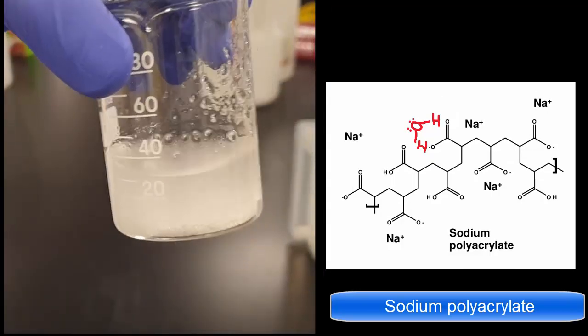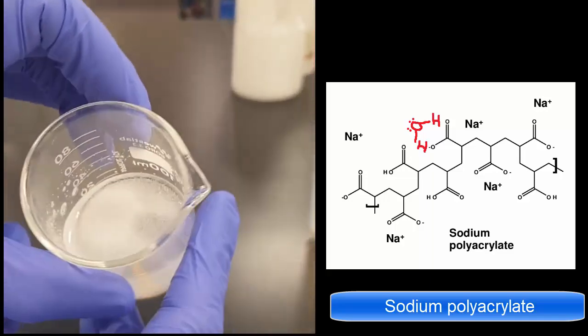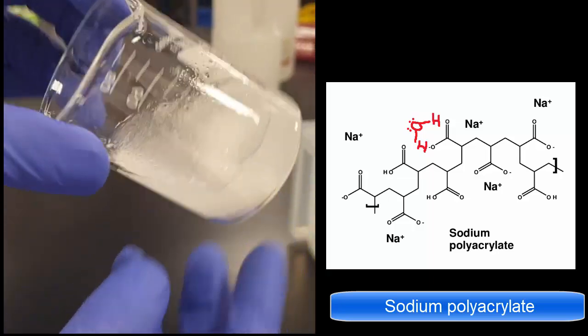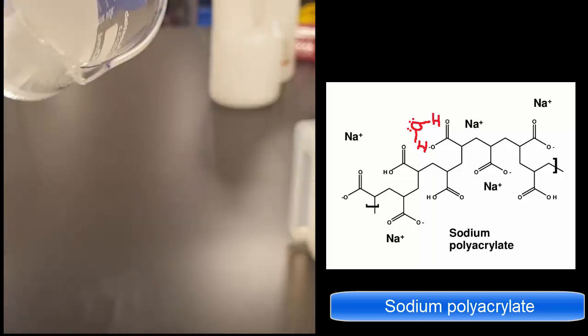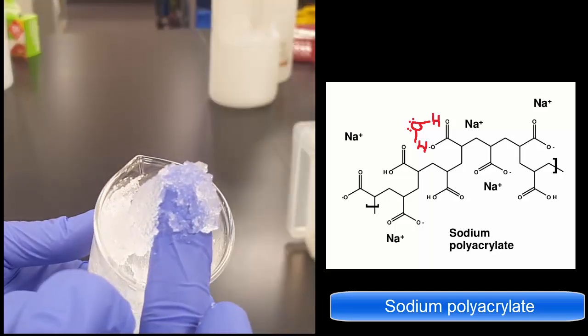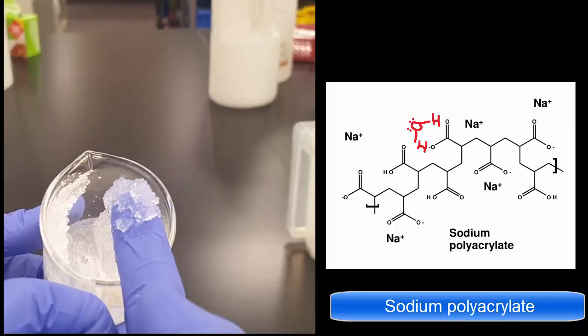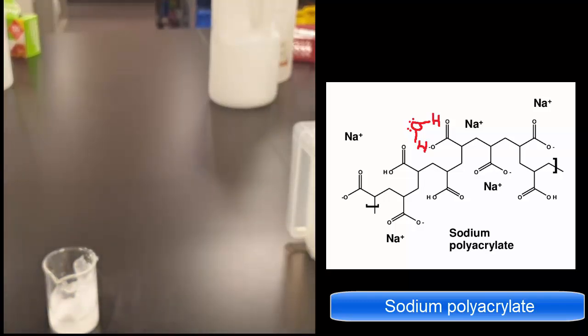And so what you can see is I just put a bit of water in and swirl it around, and there's no letting go of that water. It just holds onto it and just stays there, stays in the beaker, just won't escape from it. And you can see from its structure, it's just completely layered with the perfect attraction to water to lock it in place, unlike the other structures.